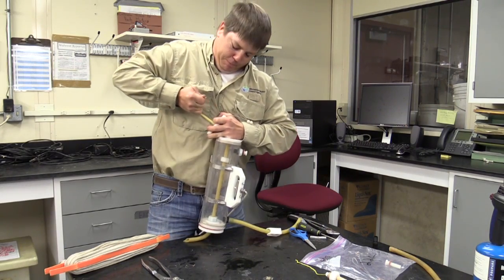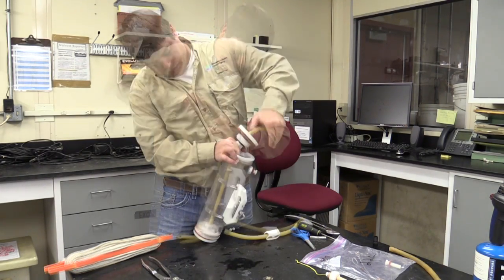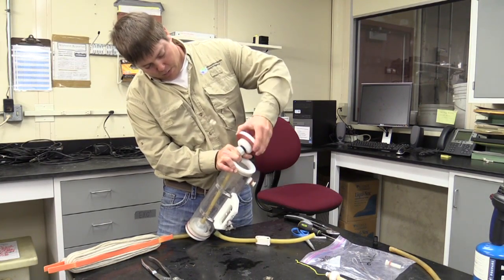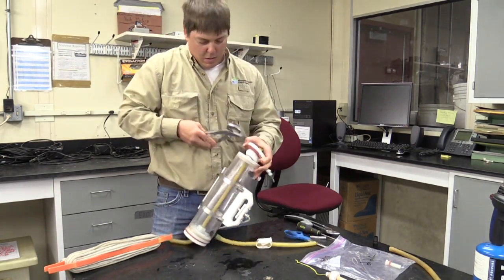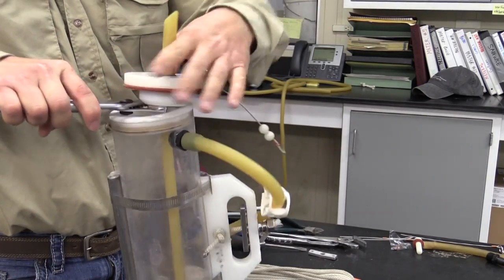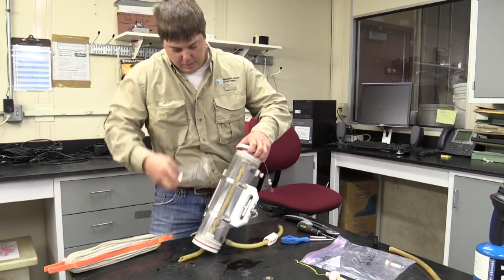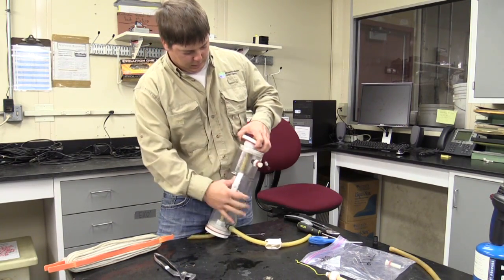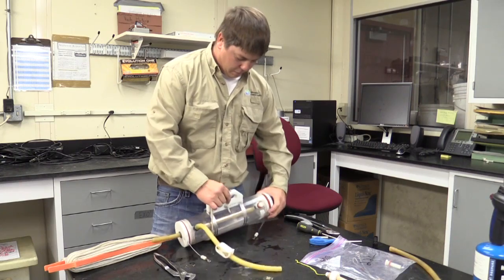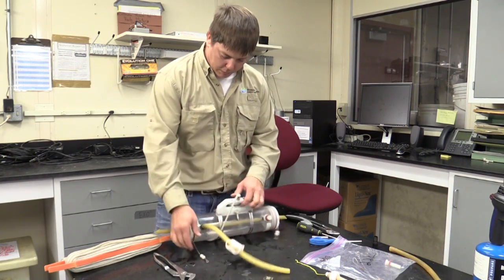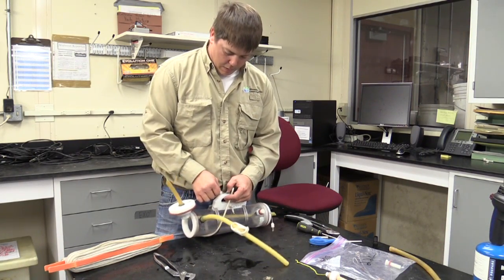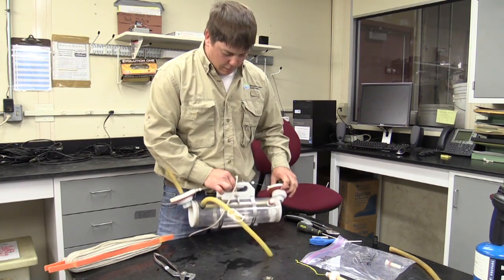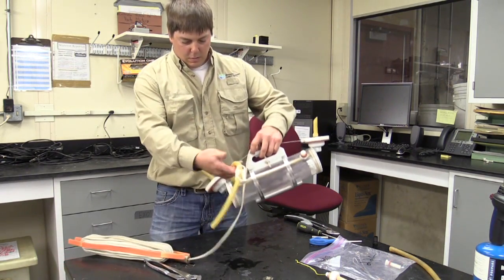And it's usually a pretty good struggle. Just kind of screw it right down. It's usually twisted up. You can see. It will work now.